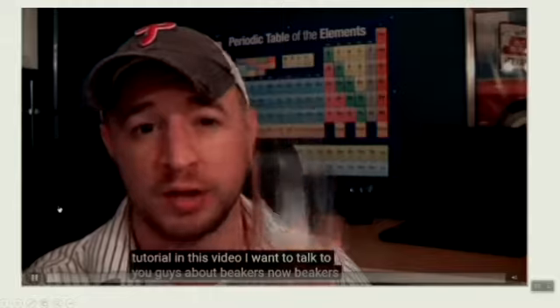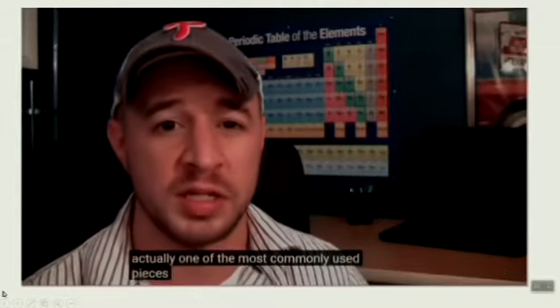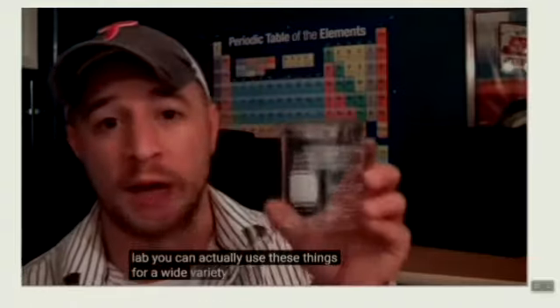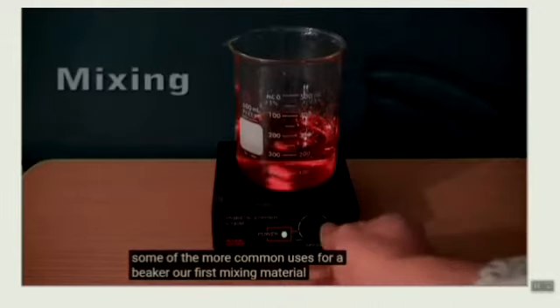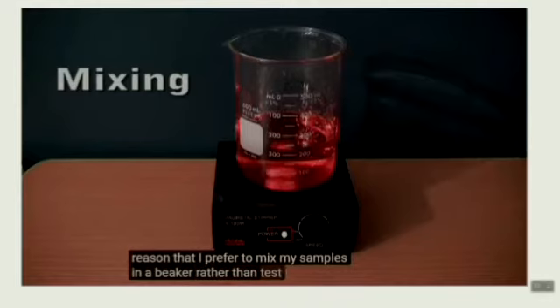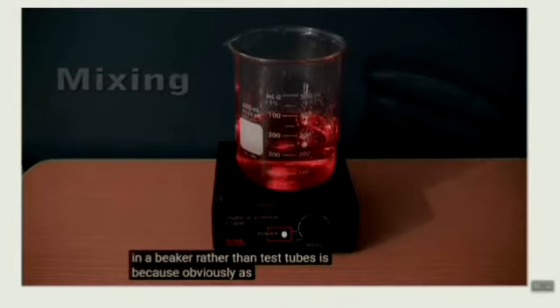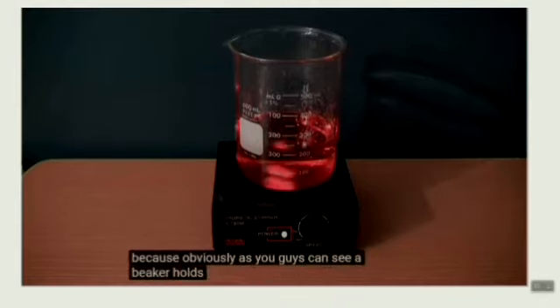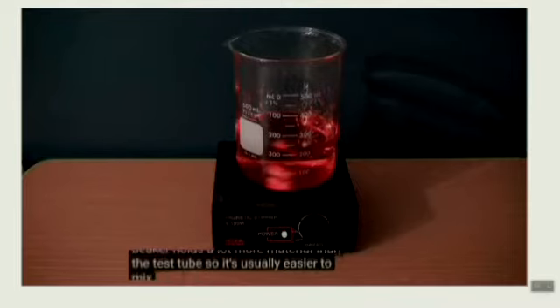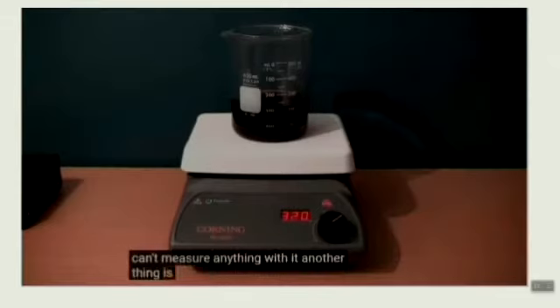Beakers. Now, beakers are actually one of the most commonly used pieces of equipment in your chemistry lab. You can use these things for a wide variety of different uses. Some of the more common uses for a beaker are, first, mixing material. The reason that I prefer to mix my samples in a beaker rather than test tubes is because, as you can see, a beaker holds a lot more material than a test tube, so it's usually easier to mix stuff in. Another thing is boiling.